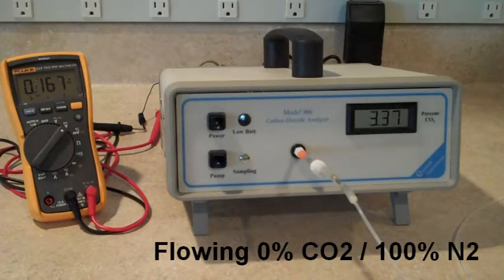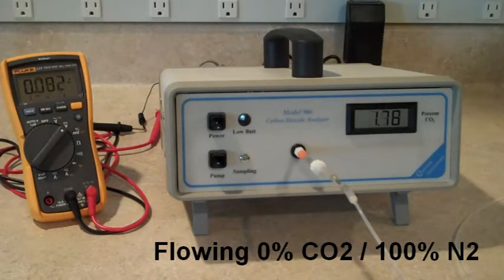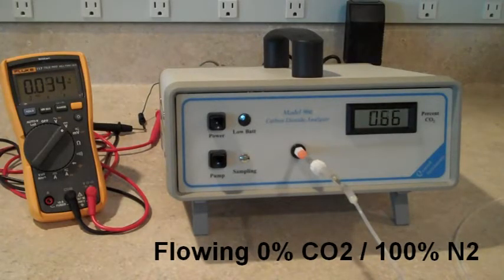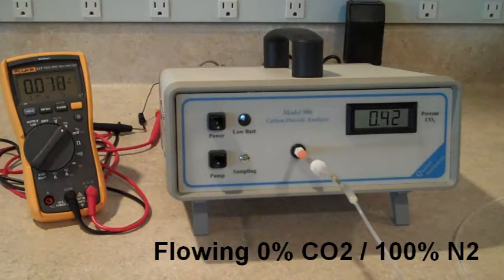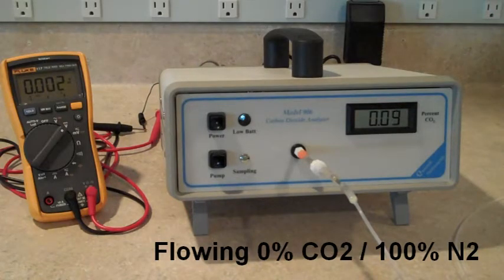Now we're going to flush the analyzer with pure nitrogen, and as you can see, the sensor responds very quickly to changes in concentration.